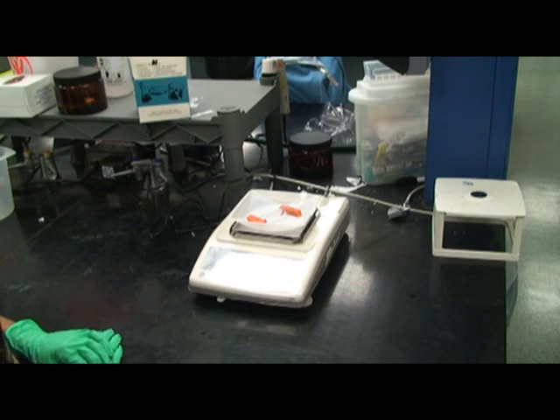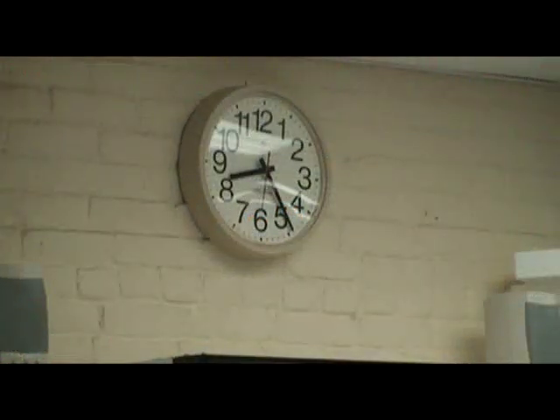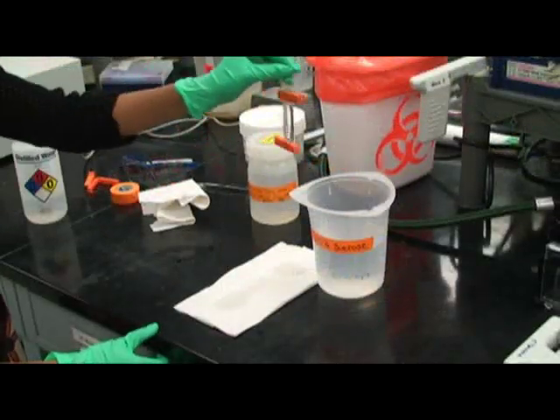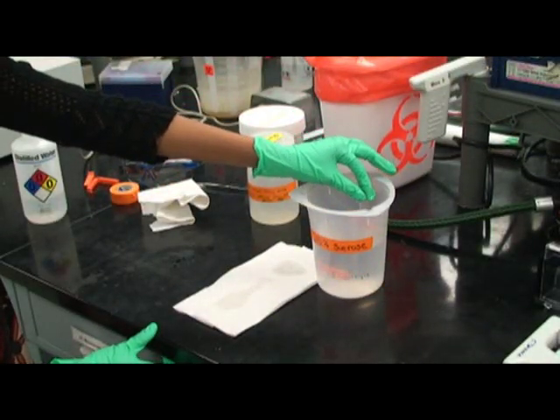At fifteen minute intervals for sixty minutes, remove all bags from the beakers, carefully wipe off all water, and re-weigh the bags. Put all bags back into their beakers at the same time.